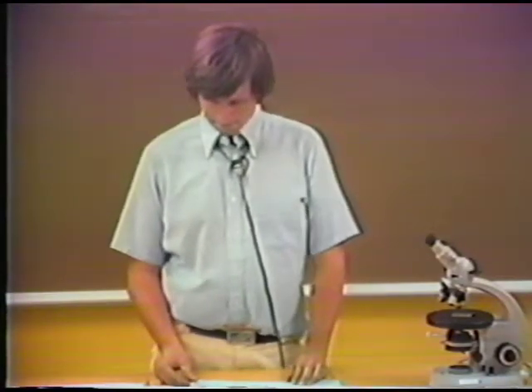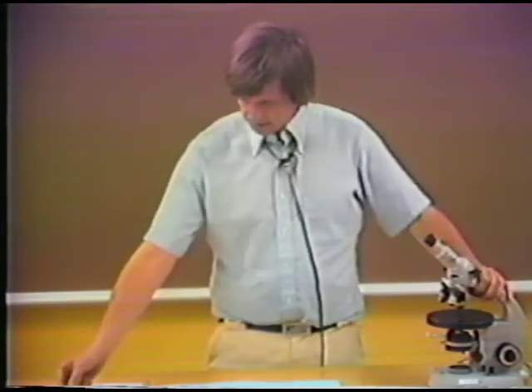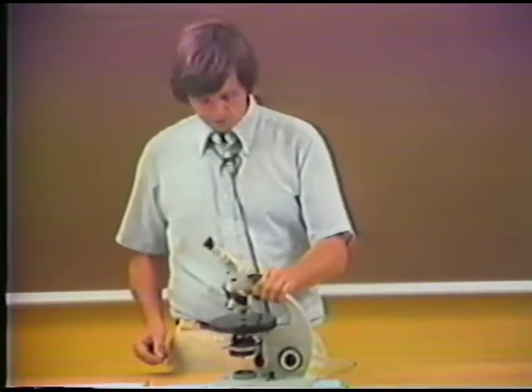Okay, now we can combine the information about the position of the slow ray of the mineral with information about the crystallographic form of the mineral. And let me demonstrate how we do this. This is measuring a property, for example, called elongation of the mineral.